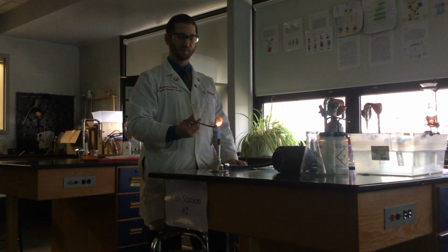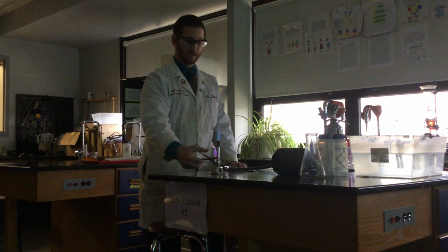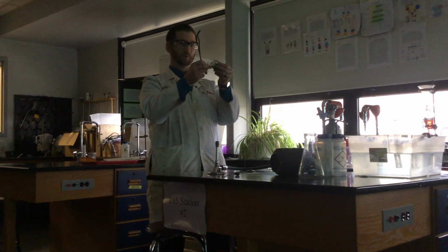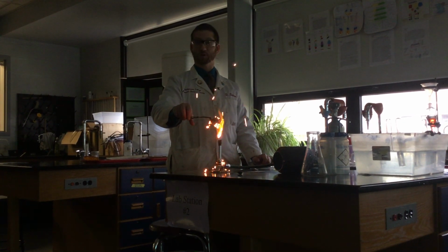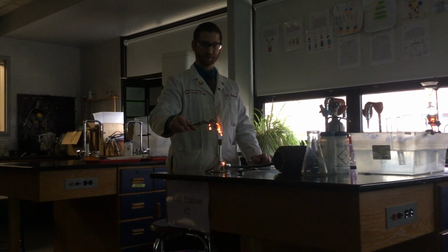What would make this reaction faster? Very similar to last slide. More surface area? Yeah, so let's go ahead and spread this out a little bit. You can just keep the film rolling. So we'll try to get this as spread out as possible. That's pretty spread out. Reaction definitely occurred a lot faster.